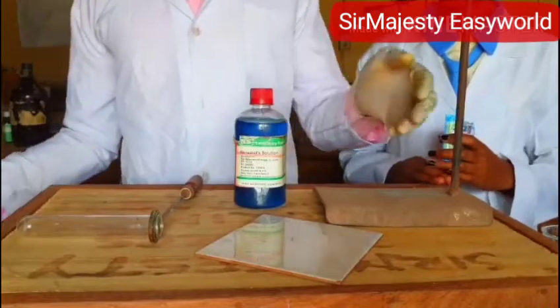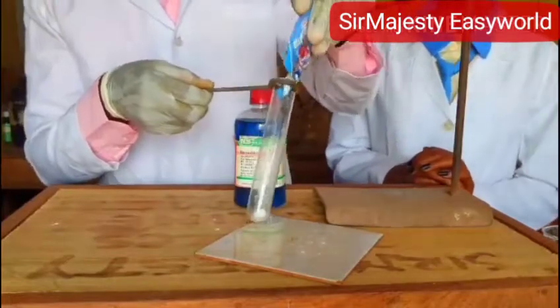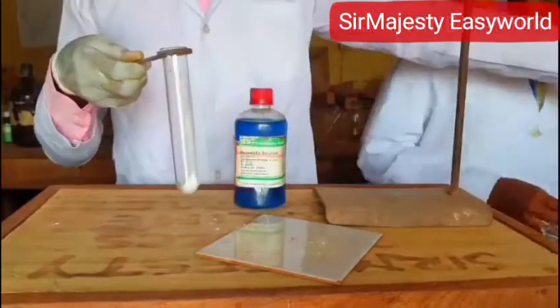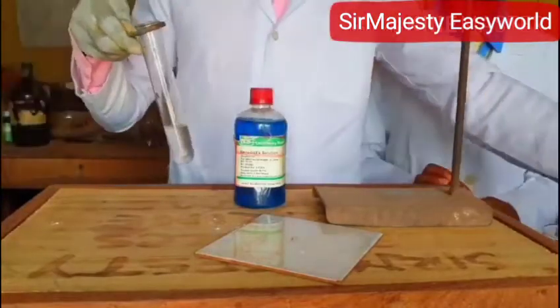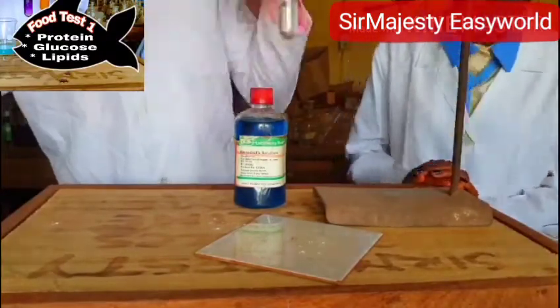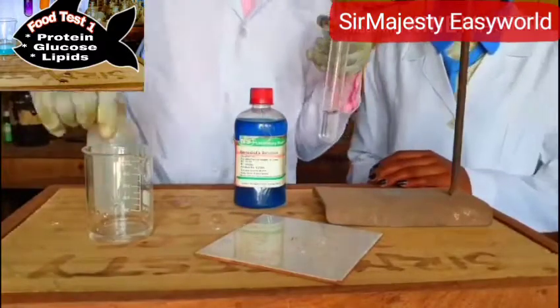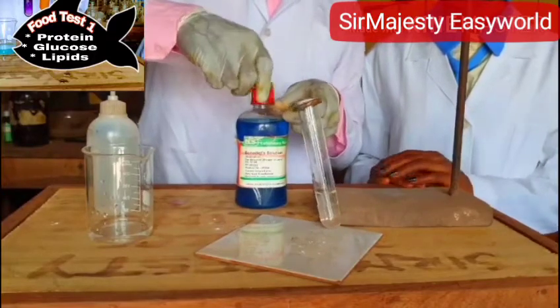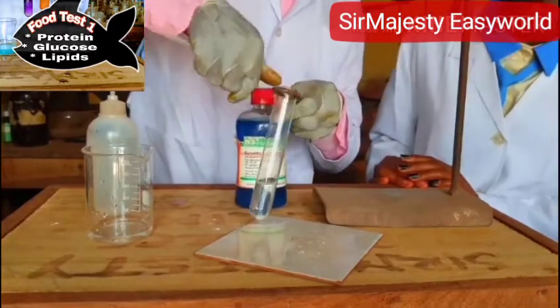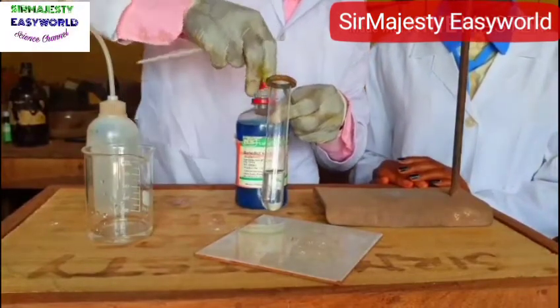So how do you go about that? Bring the glucose — this is glucose. So when we test for glucose, there are tests for reducing sugar. Glucose is a reducing sugar, and it's called an aldose sugar because it has the aldehyde functional group.